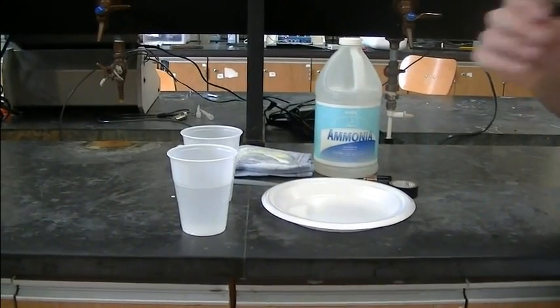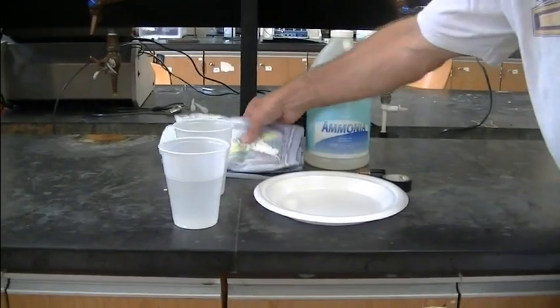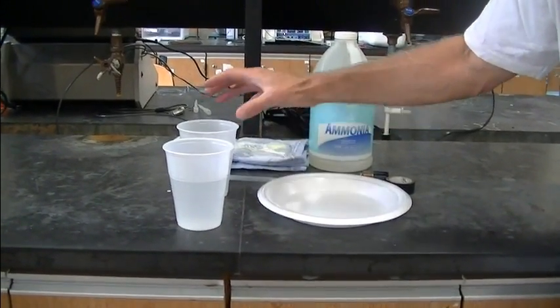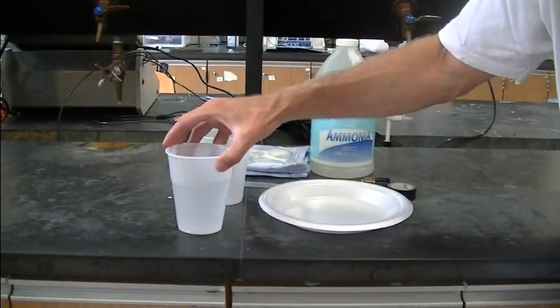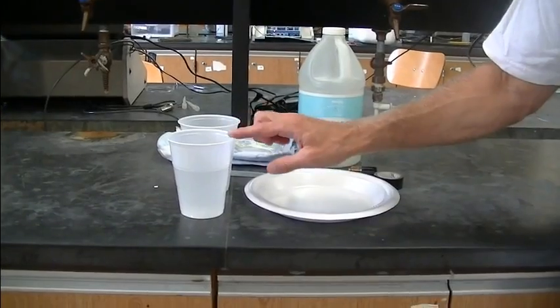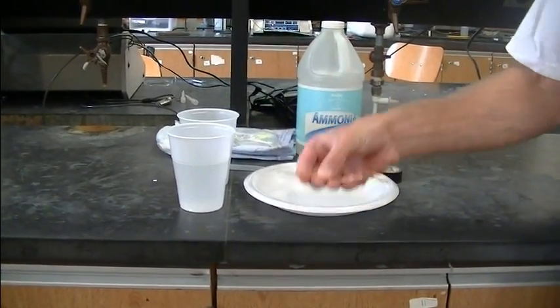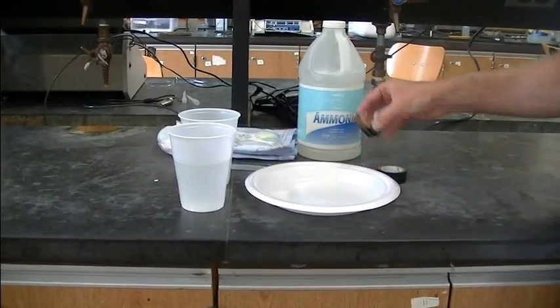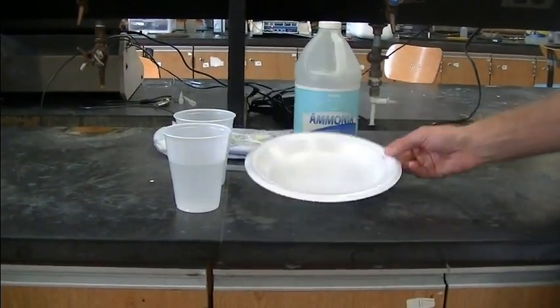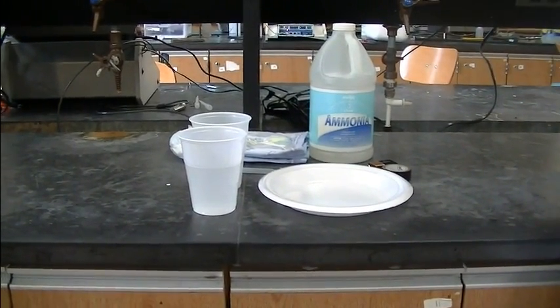What you'll need to do in this experiment is some household ammonia, a diaper, medicine dropper, some cups, one of them should be filled with some deionized or distilled water that you can buy from the grocery store, two copper wires, a nine volt battery, some tape, and a plate, preferably with a white background that's going to help you see the dissolving of the copper.